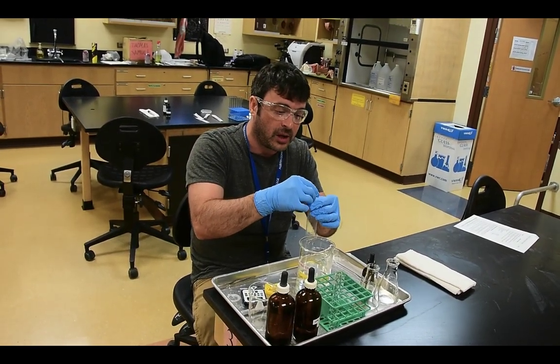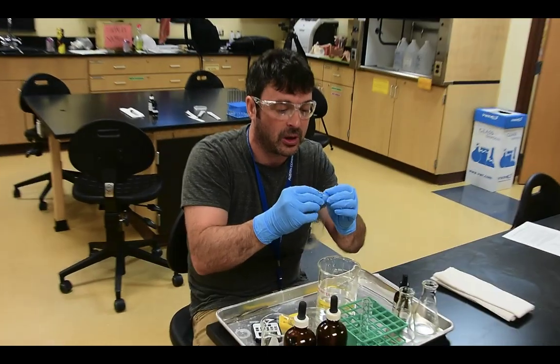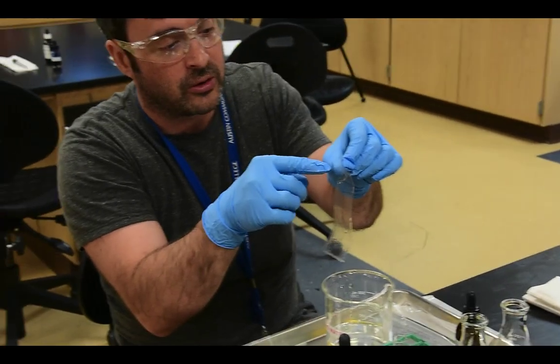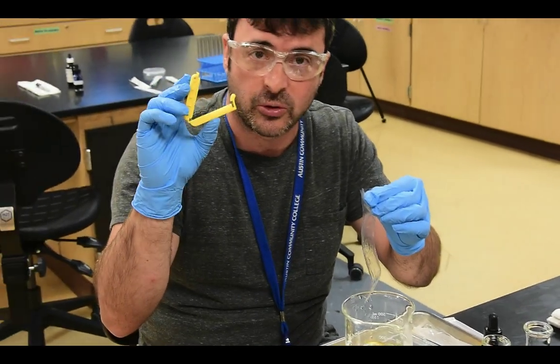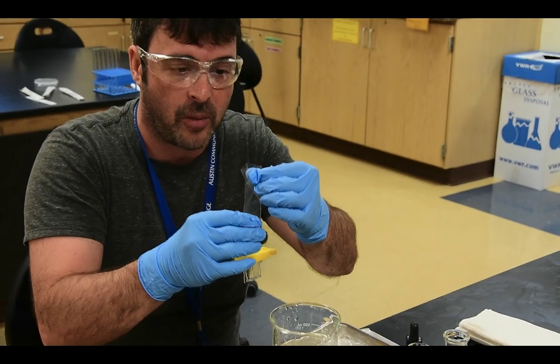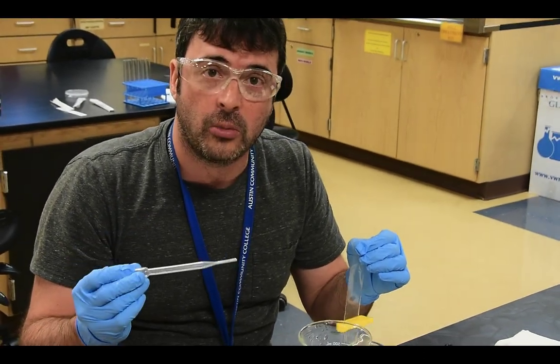So the first step in today's lab is creating a little artificial cell. Now in order to create an artificial cell, you have to open up your dialysis tubing. You do that by coming to the end, like it's a grocery bag, and rubbing it between your fingers, and you'll see the dialysis tubing pop open. Now these clamps, which most certainly don't go in the garbage if you're doing this lab in person, I'm going to put one of these bag clamps at the end of the bag on the opposite end from which I just opened it.